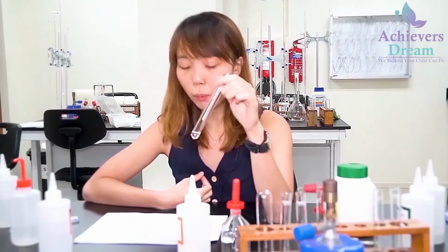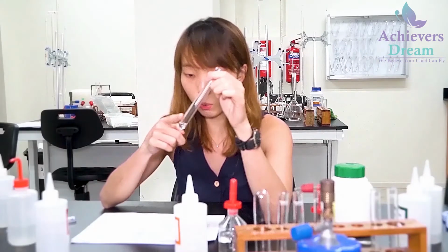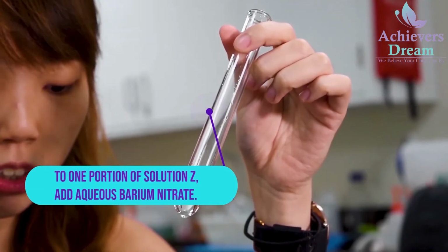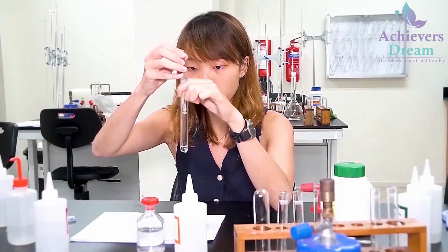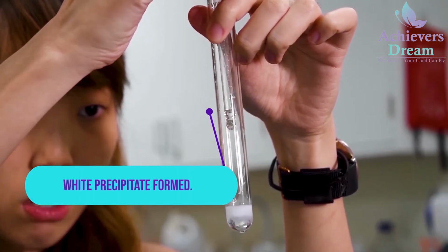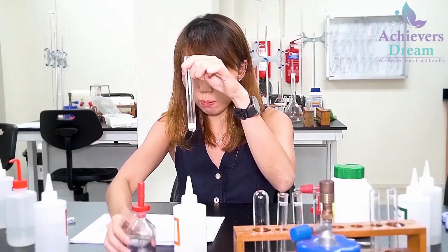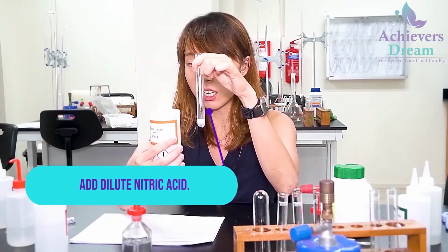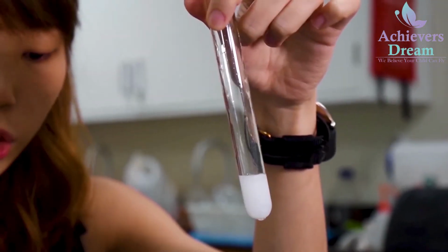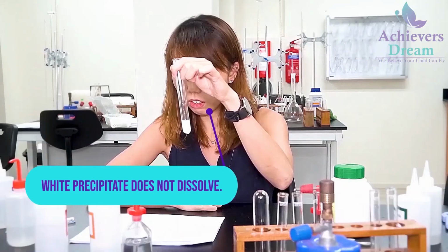Okay, so for B part 1, divide solution Z into 2 equal portions in 2 different test tubes. So this is to 1 portion. I'm going to add an equal volume of barium nitrate solution. Upon addition of barium nitrate, there is presence of a white precipitate. Then after that, they said to the mixture from above, add dilute nitric acid. Even with the addition of dilute nitric acid, the precipitate formed still remains insoluble.